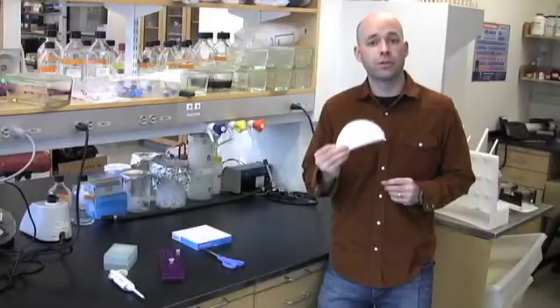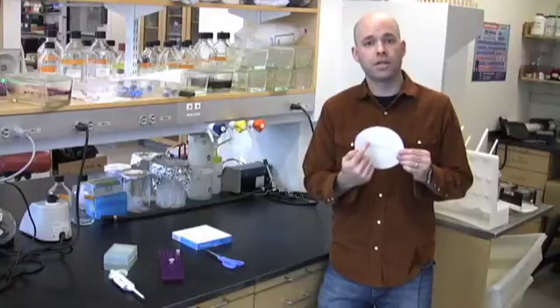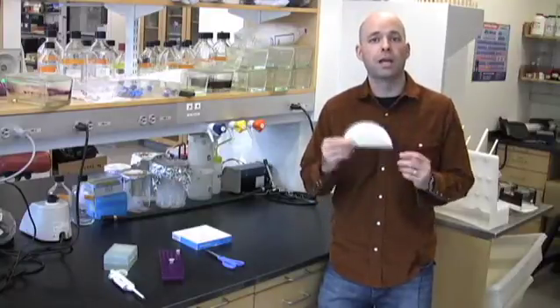Now the great thing about the filter paper trick is that you can put a lot of discrete constructs in one filter paper and mail it off.